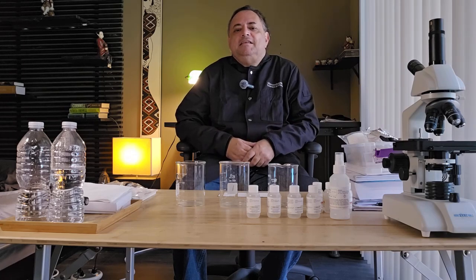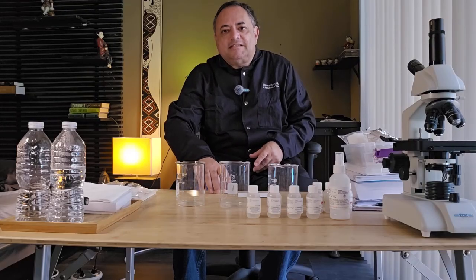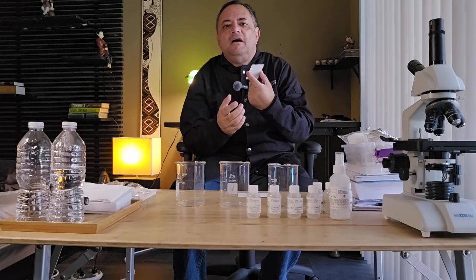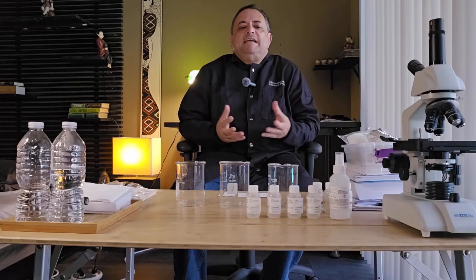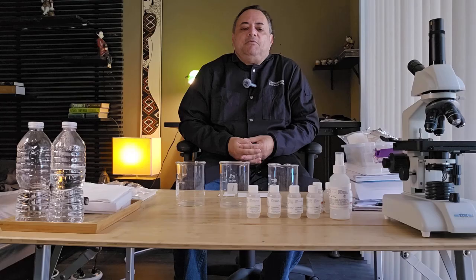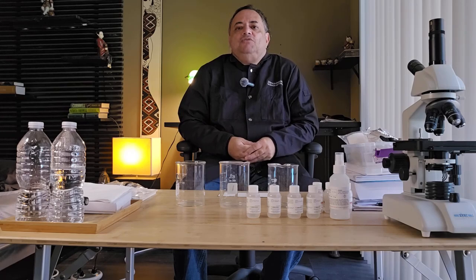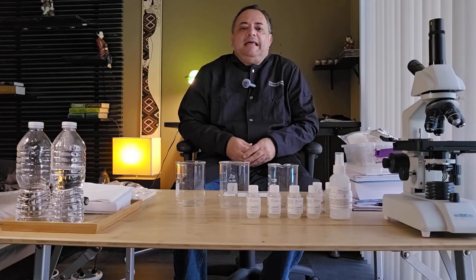The silica gel is usually spread on a glass or plastic surface. For today's experiment, I've got silica gel plates, so I've got a thin layer of silica on a glass plate. The rest of the process is the same as paper. At the end, we visualize the separated compounds. We can use various dyes. We can use UV lighting. Certain compounds will fluoresce under UV lighting.